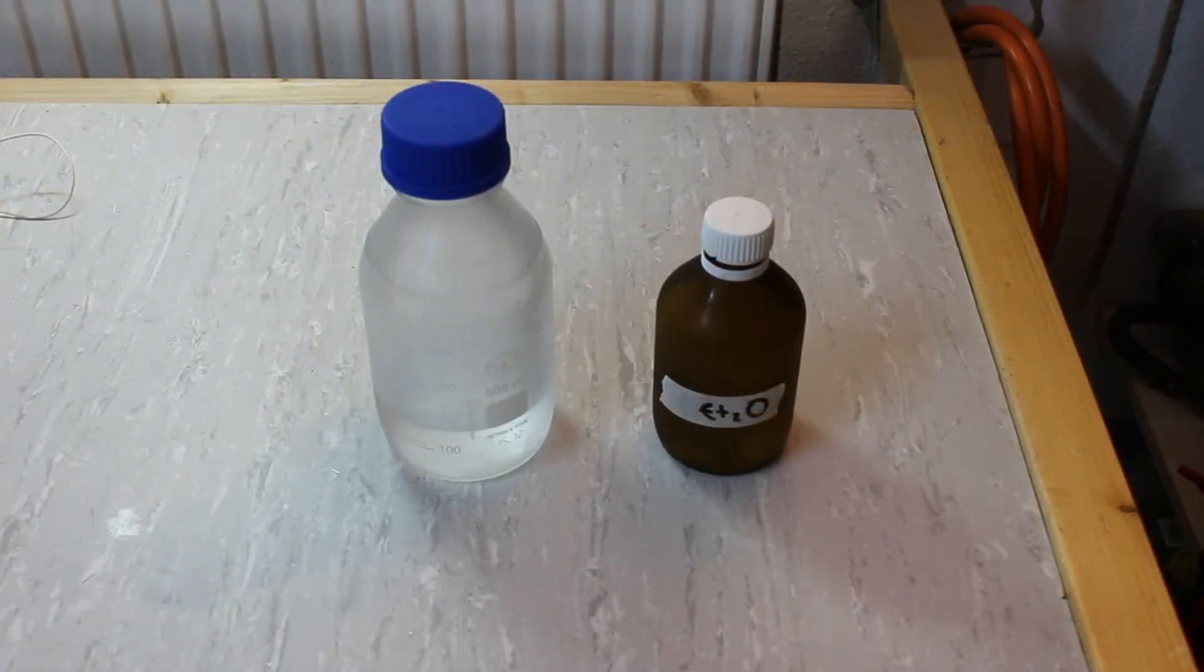I stopped the distillation once the stillhead temperature started to rise. So here's our final yield of diethyl ether. I'd say it's roughly 250 milliliters and I think it's reasonably pure.